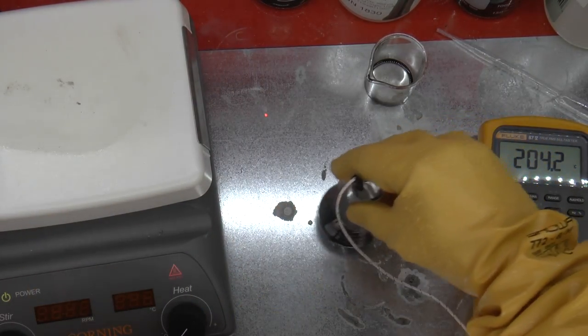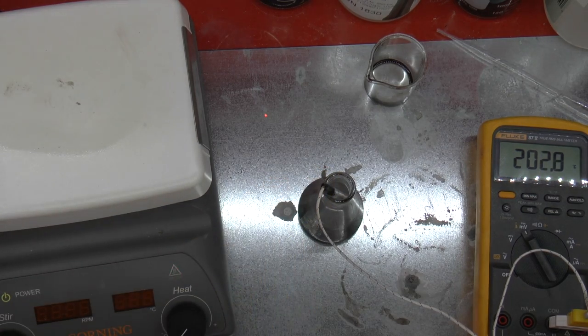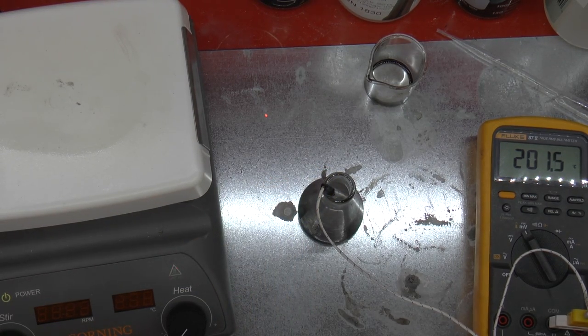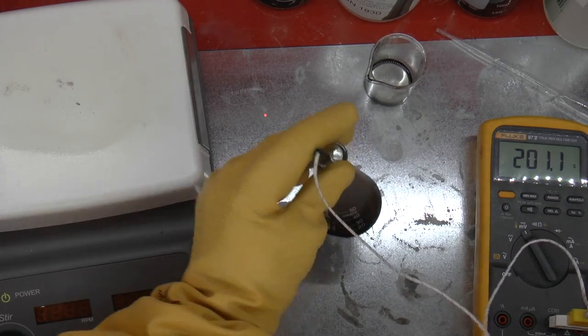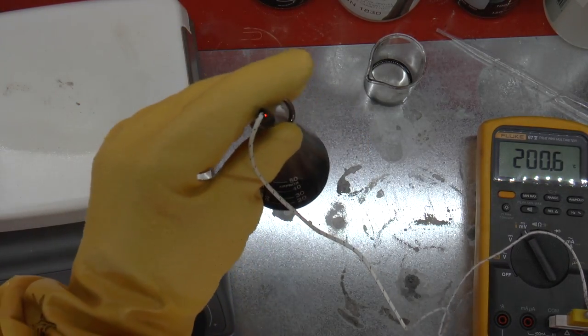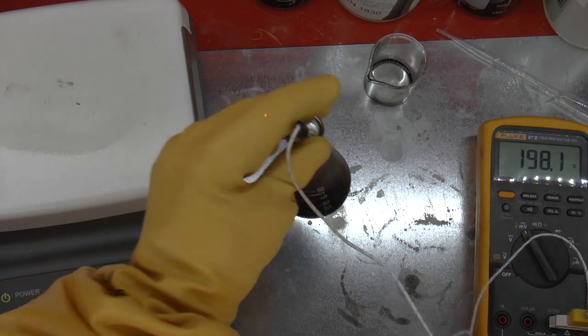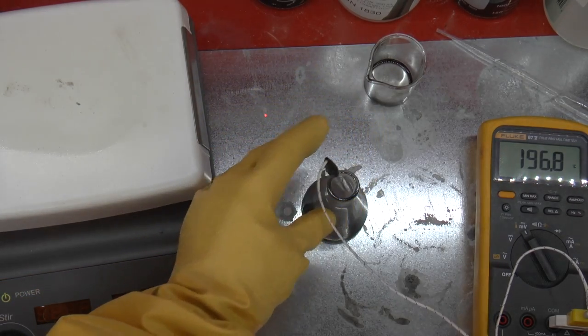Usually what I do is I leave it for about 10 minutes at 200, and that I believe actually does the job of melting the chip. But I wanted to see what would happen if I just let it go. So let's fast forward while we cool this down.